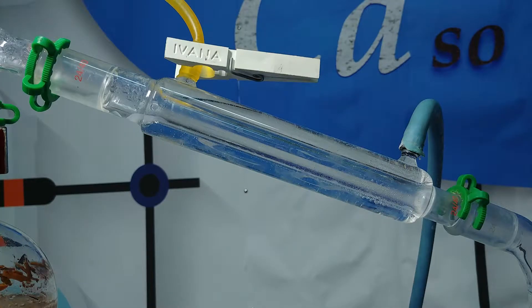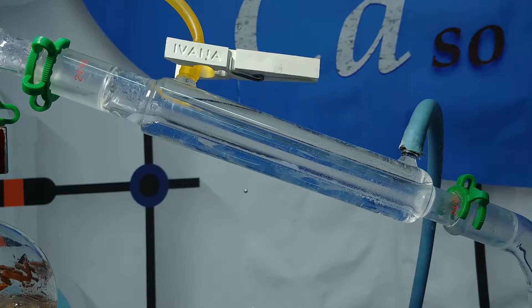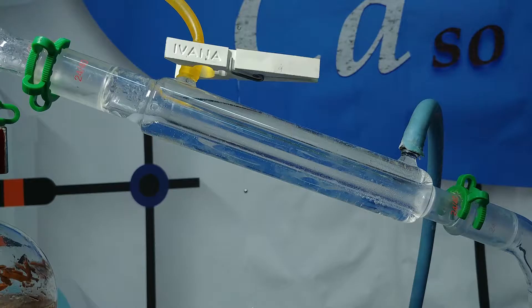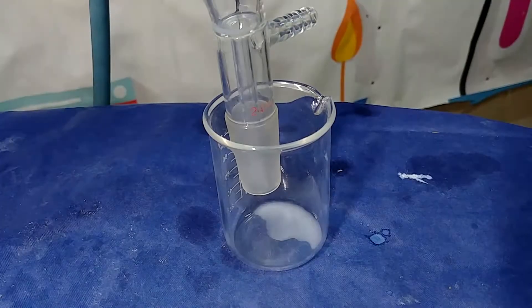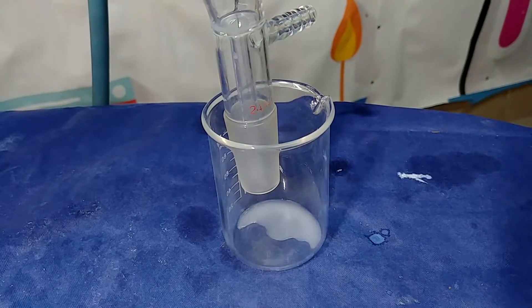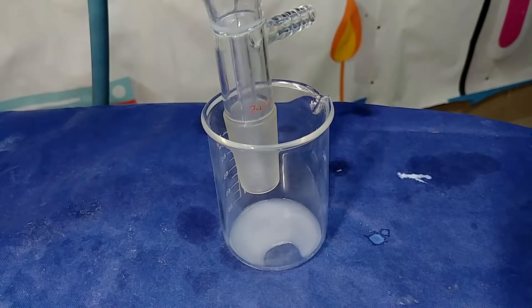As we said before our distillate is at the beginning really cloudy. After that when we first obtain our first 100 ml of distillate we can see that the color tends to clear with time.